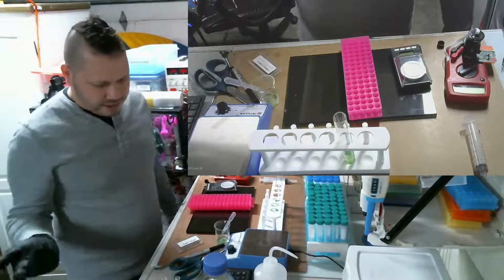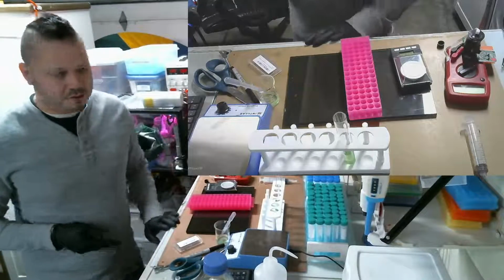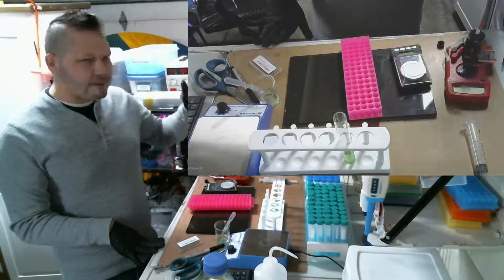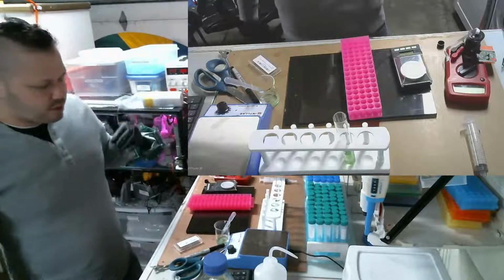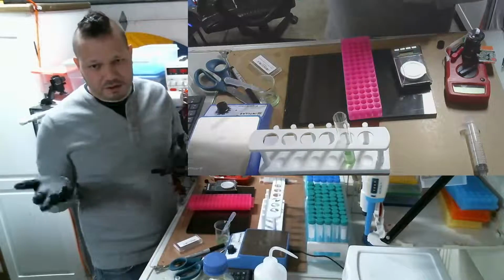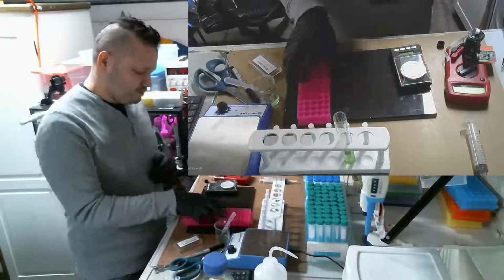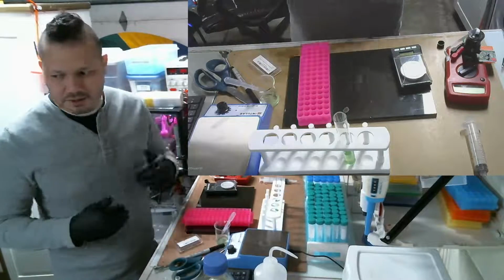Now, the count itself, I can only get to 3 significant figures, because that's how much the voltage reading is. The voltage reading is on here. It's because the top voltage is 400 millivolts, and it's 3 significant figures. So obviously at the end you can only be 3 significant figures in accuracy. But that gives me more than enough accuracy for what I'm looking for in terms of error bars. It gets me within the significance that I need.